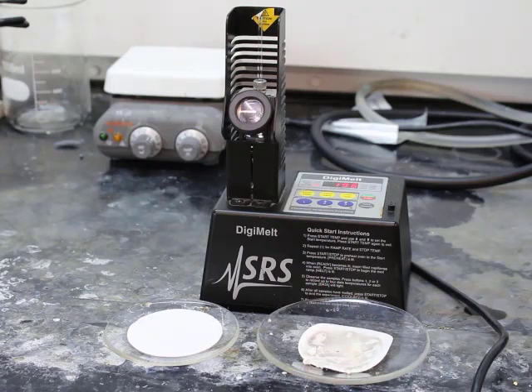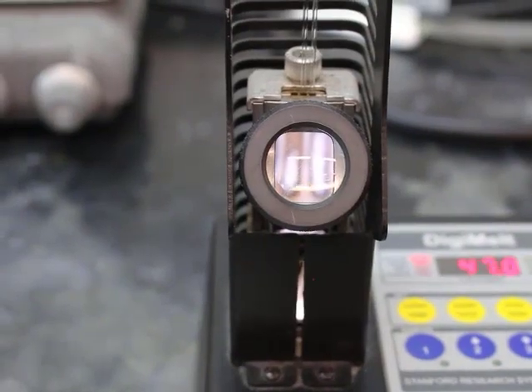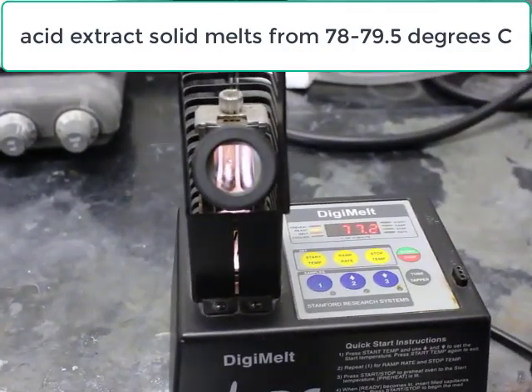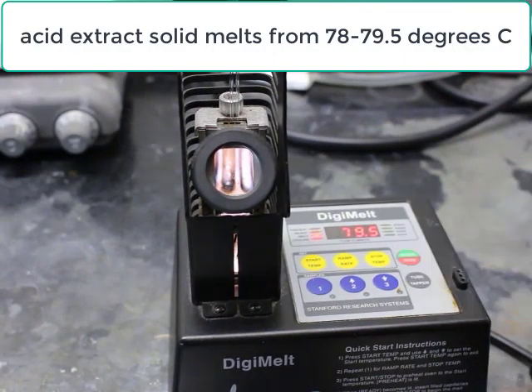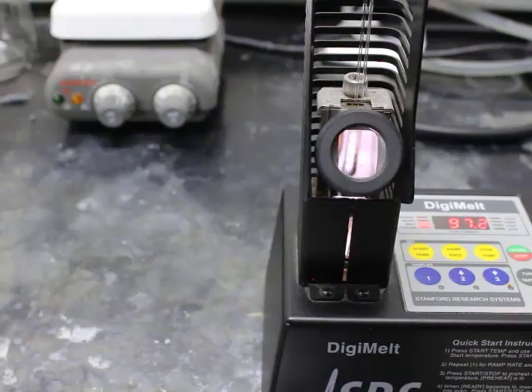And so now setting up this Digimelt, the melting range is going to range from approximately 40 to, one of our highest melting points is approximately 205. So going to go from about 30 to 250. All right, so we can see our acid extract has already started to melt around 78. Started at 78 and finished around 79 degrees C. You can kind of see it finishing up.